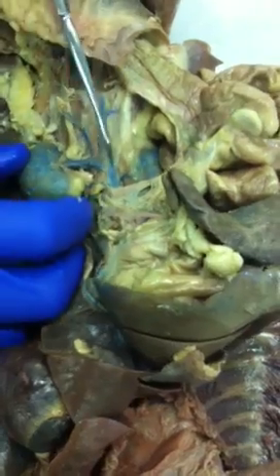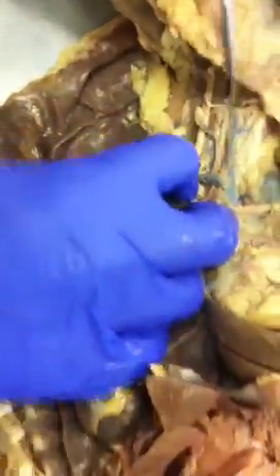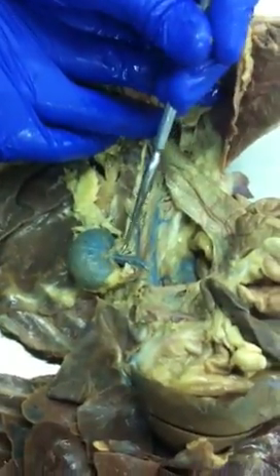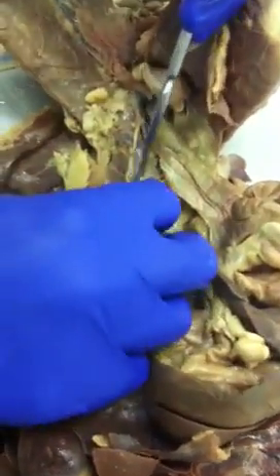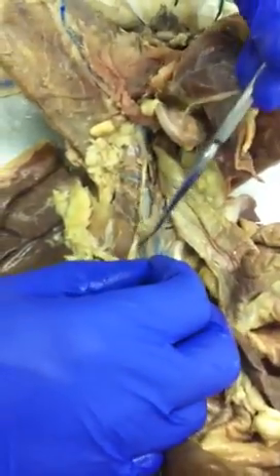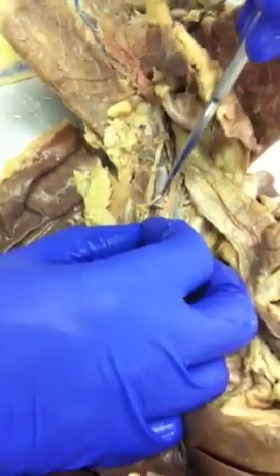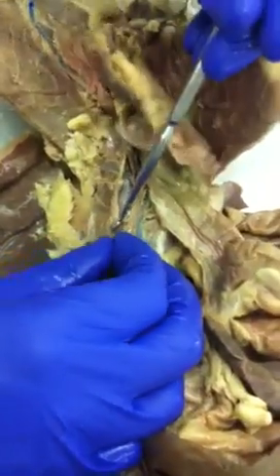Just following down, you have the renal vein here. There's an artery on the underside. It looks like they lost their dye. I can see the aorta is just kind of pale. But you have renal artery and vein here. This is ureter. Kind of running along with the ureters are the gonadals. So in the male, they're spermatic, and in the female, they're ovarian. So artery and vein. The artery is under here, it just didn't take the dye. The vein is still here, you can see the blue.